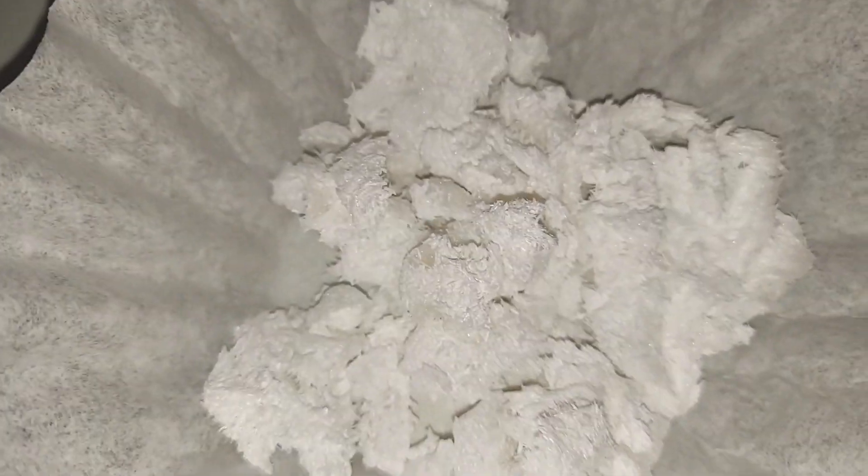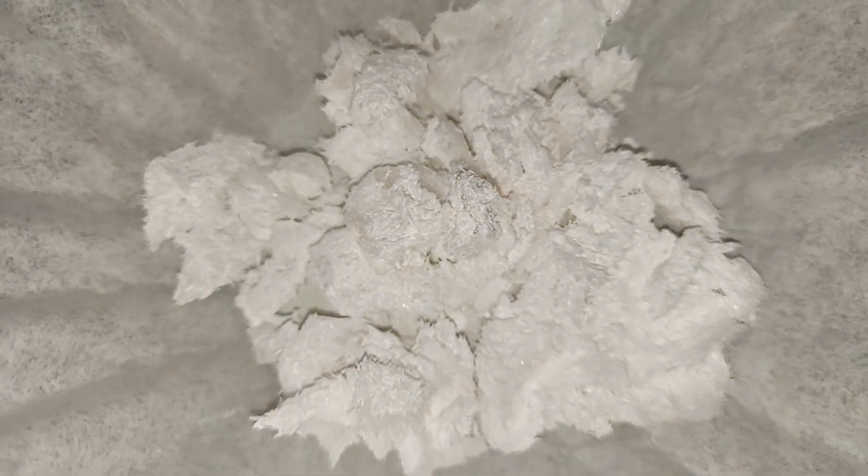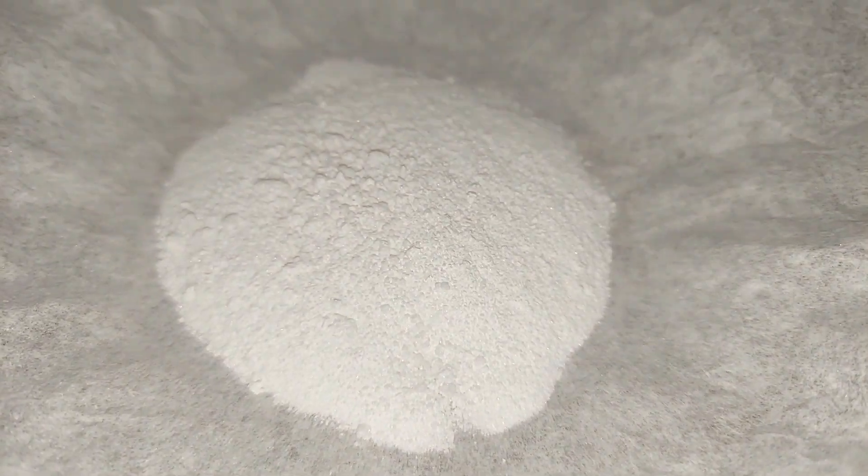The lead acetate's completely dried. It's kind of a funky chunky looking substance here. The final pile of lead acetate dried and crushed.